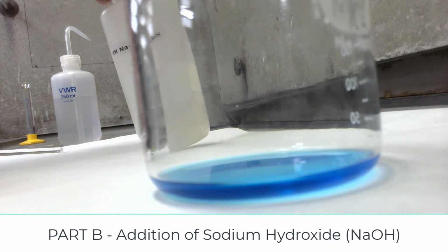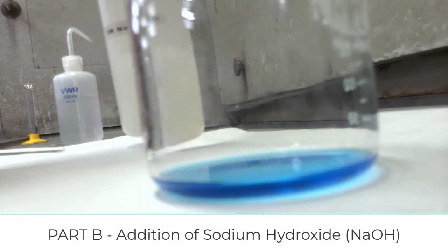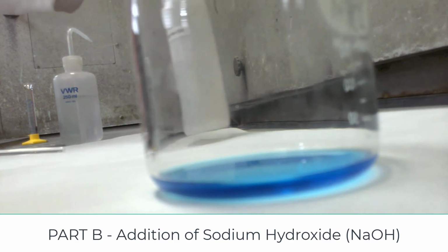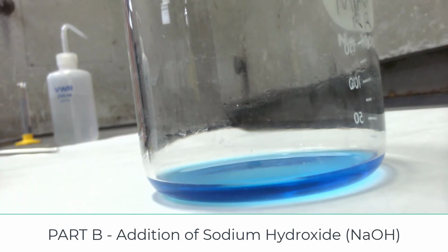Is it busy? Right here? Remove it. Okay. So now I'm going to add some sodium hydroxide.